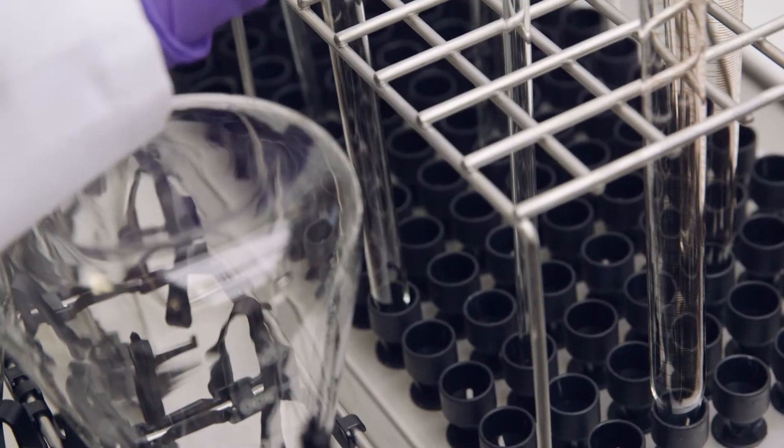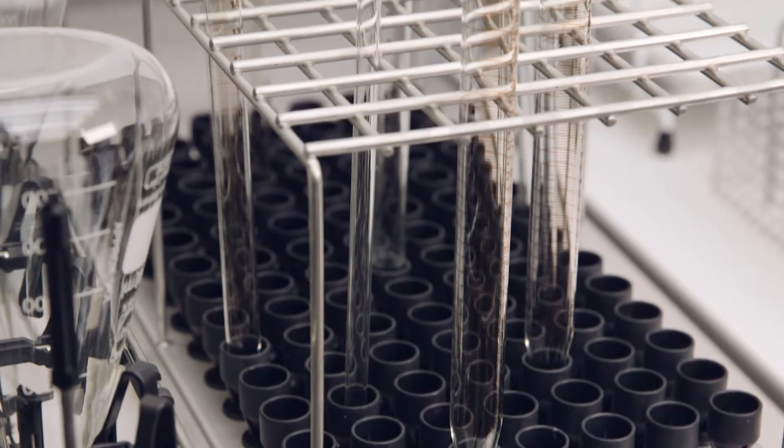For pipettes, it is important that the tips of the pipettes face downwards in the load carrier so that they do not become blocked.